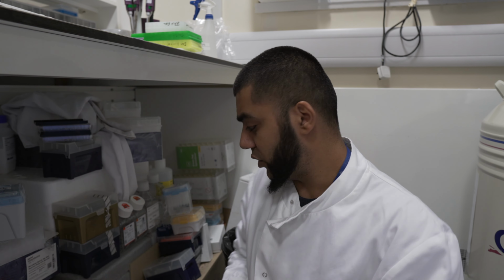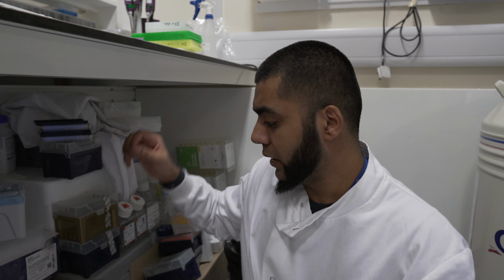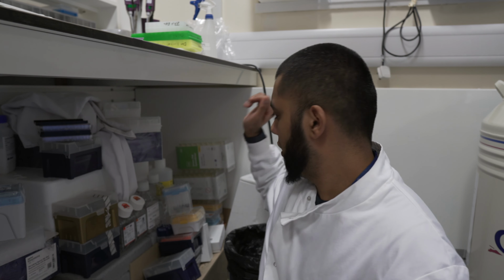But yeah, the rest of it is just various bits and bobs of boxes, types of plates, fluorescent plates. We've got various other bits, general reagents that you probably have in your lab anyway. But what I've shared is what people know already. A lot of the stuff in the lab are antibodies that people know. Those tubes are famous assays that anybody knows.